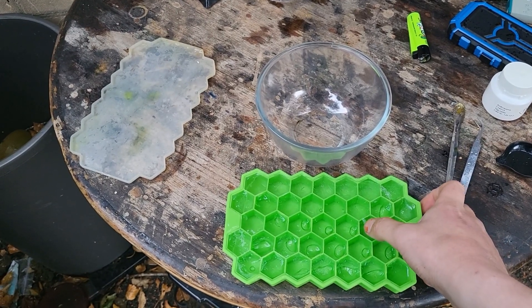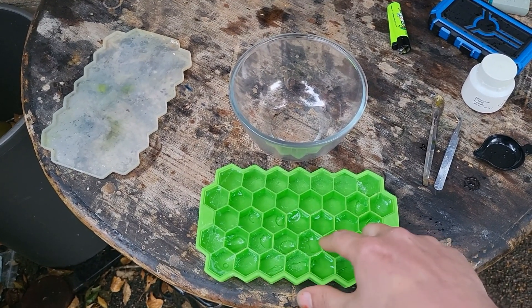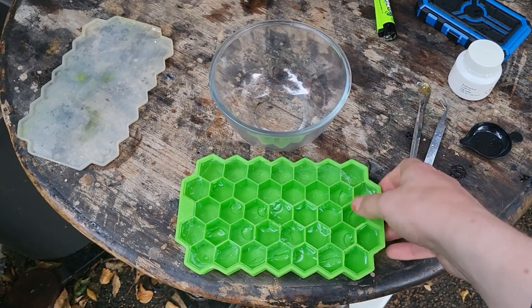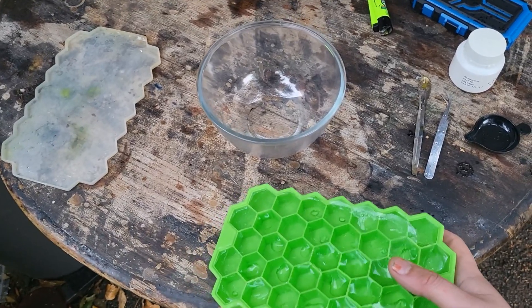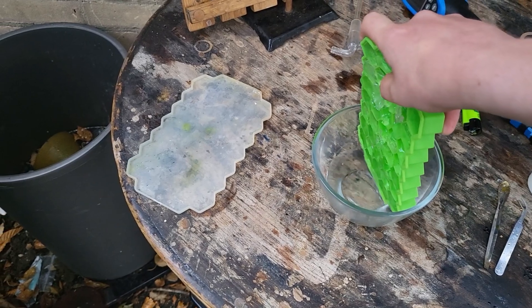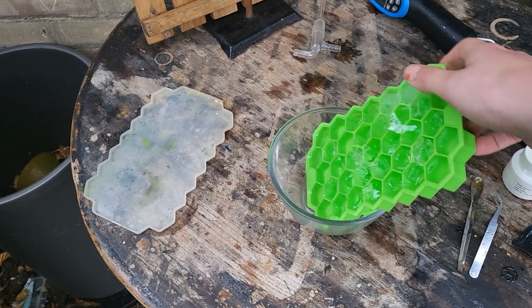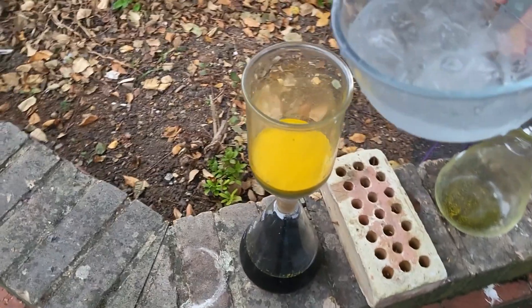These are not very frozen ice cubes but it's going to be cold, so I can get that in here, plus the ice, giving this a water washing.